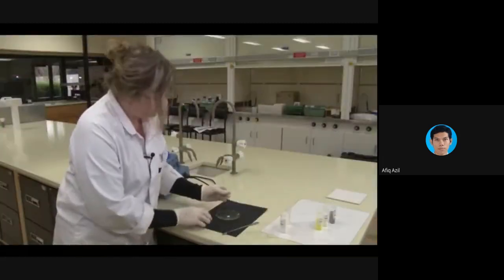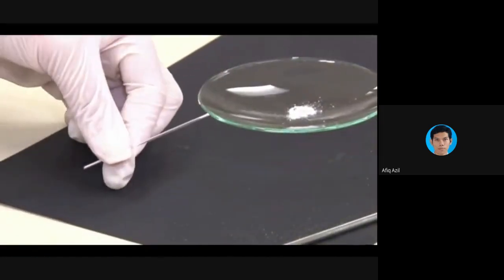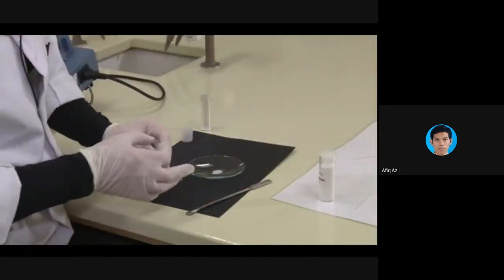If you put too much in at once, you'll end up with a big amount of compound stuck at the top of the tube. You might like to try to flick it to make it go down, but if it really won't go down, you'll need to start again.